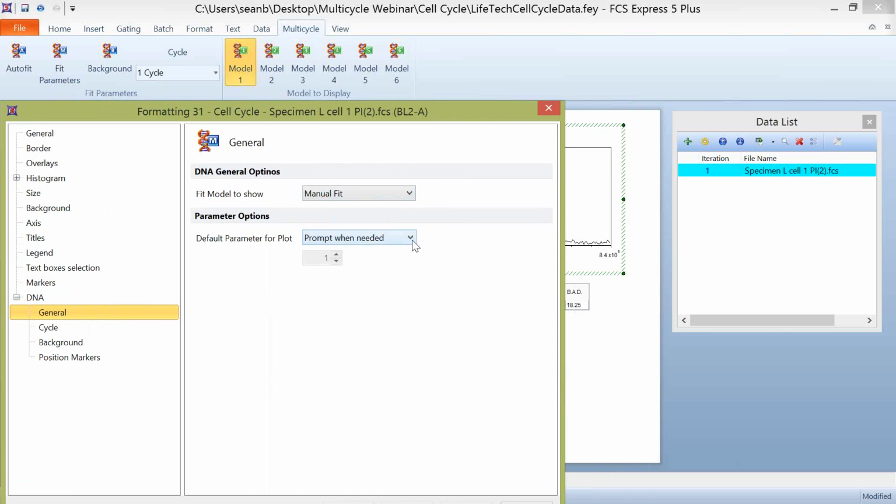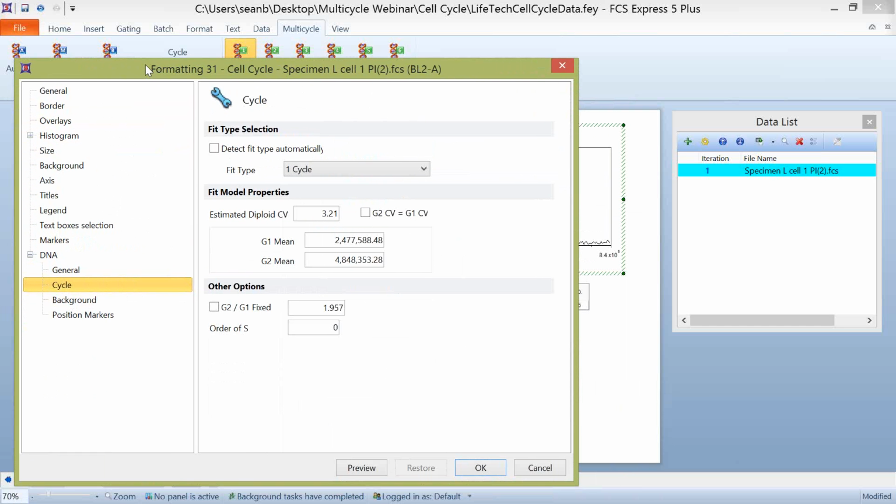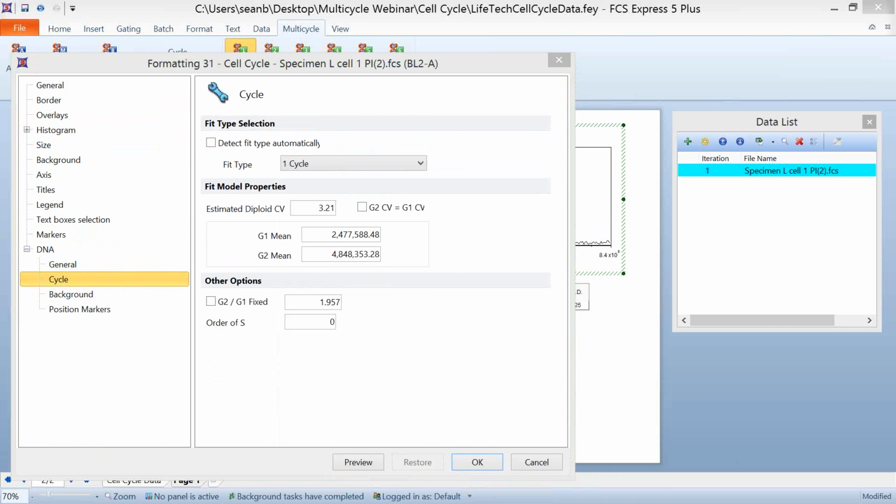In our default situation, it prompts you whenever you put in a multi-cycle plot which parameter to use, but you can also just say use the parameter below, and you can match up the parameter number with whatever parameter number your fluorescent dye for measuring DNA content is. Now, the cycle tab, or the cycle category, is really where you can come in and change a lot of the fit parameters for your data.